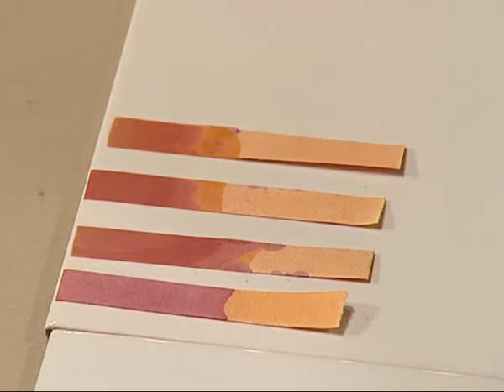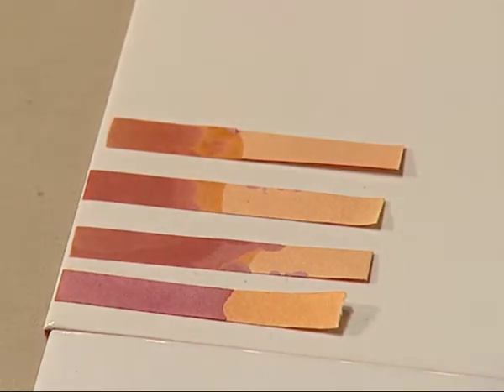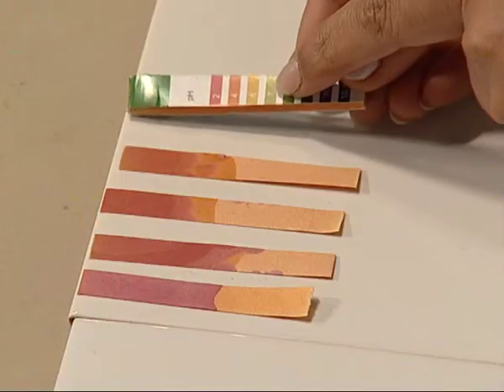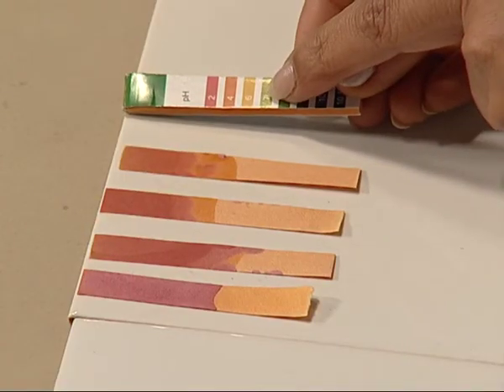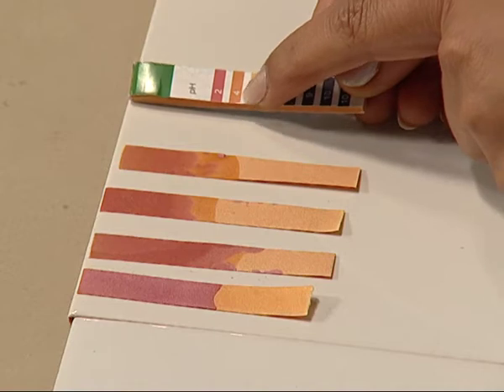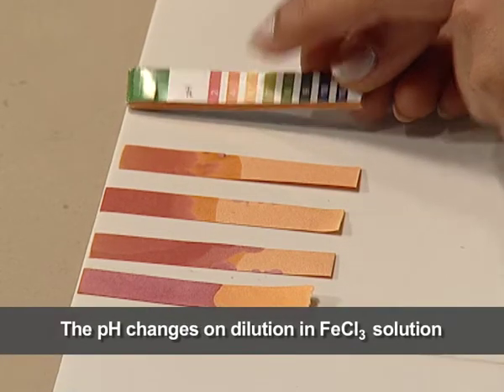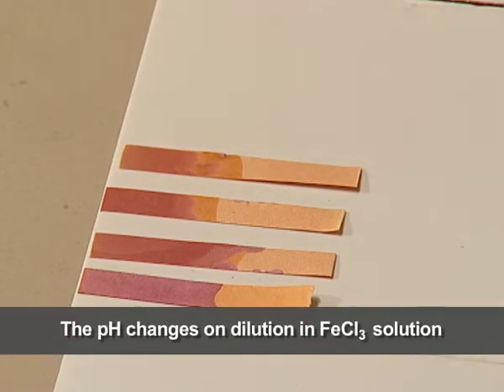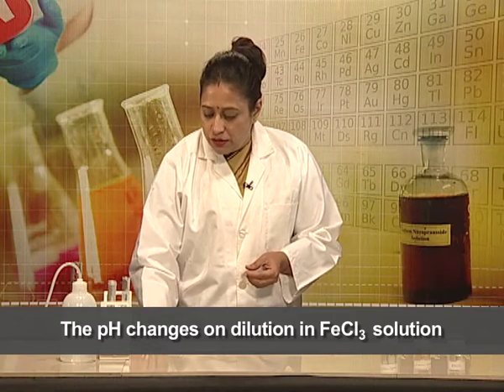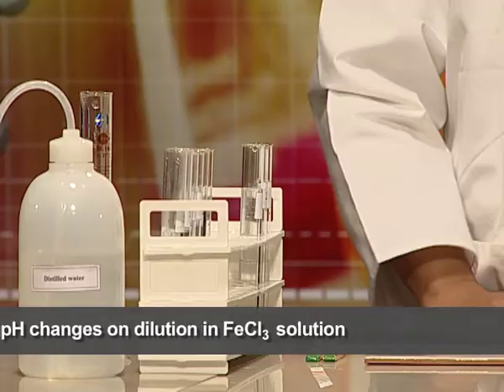Let us match the result with the pH chart. We can see that the solution which contains 20 ml of distilled water corresponds to a pH of 4. This tells us that dilution has a significant effect on the pH in the case of ferric chloride solution.